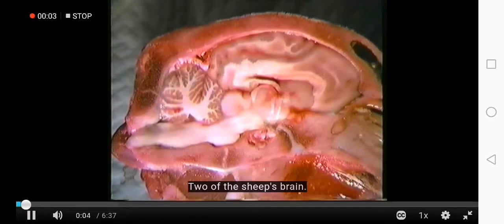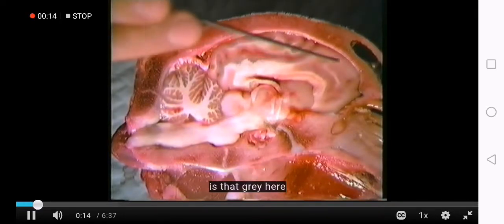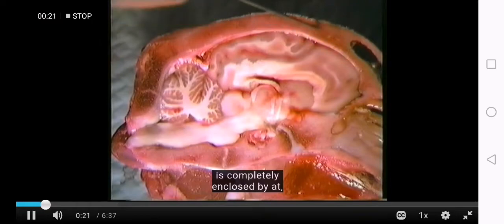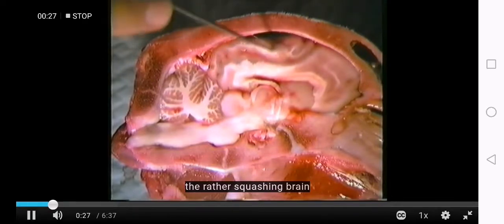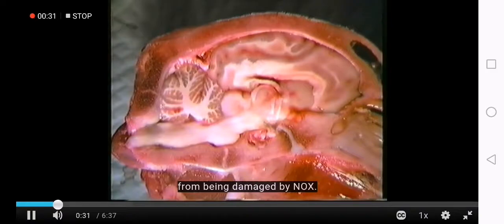View of the sheep's brain here. So this is a longitudinal section cut right through the middle of the sheep's brain. The first thing that you'll notice is that the brain here is completely enclosed by bone. And of course the function of the bone is to protect the rather squashy brain from being damaged by knocks.